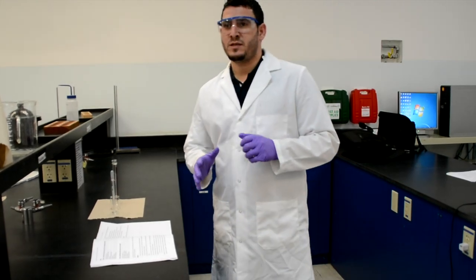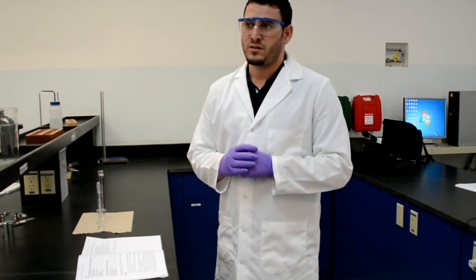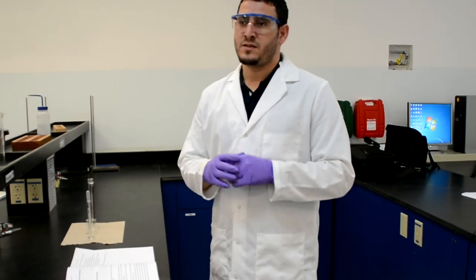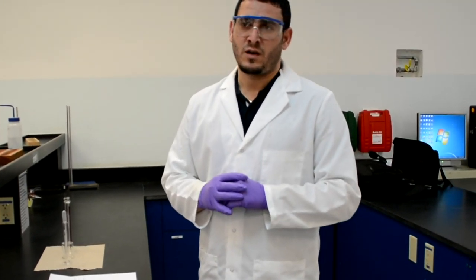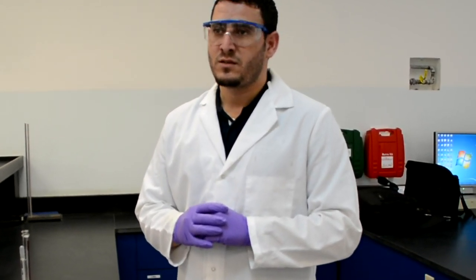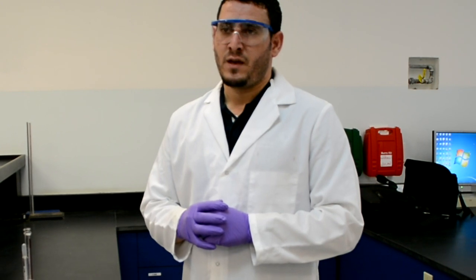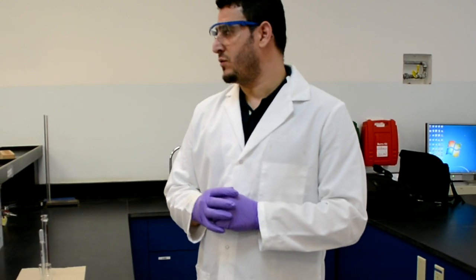Today's experiment is called an introduction to scientific investigation. It's very simple — this is just a start-up point for you guys to start in the chemistry lab. For that, we will study the precision and uncertainty on the glassware that you use in chemistry lab. Today's example will be to measure the density of water.